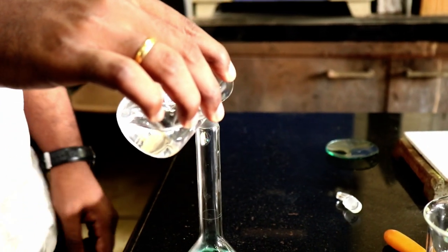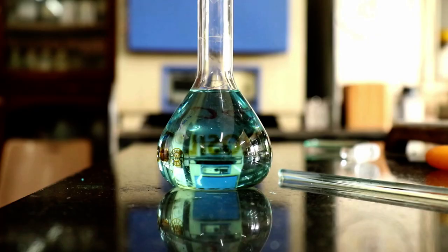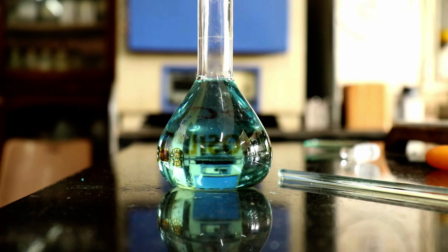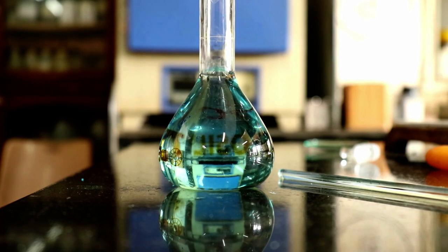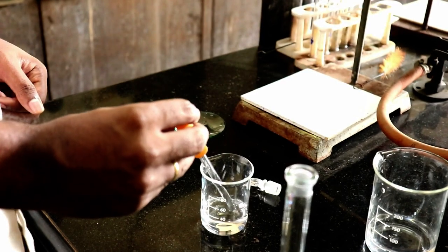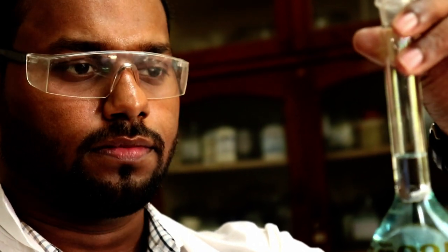Now use a dropper to bring the lower meniscus of the solution onto the calibration mark. Also try to avoid the parallax error.